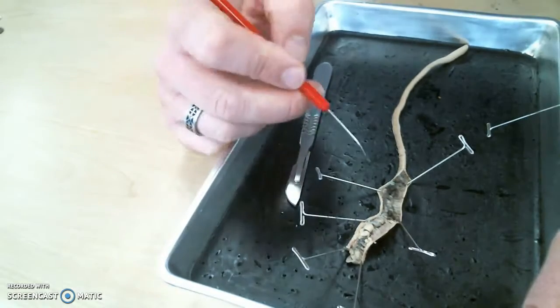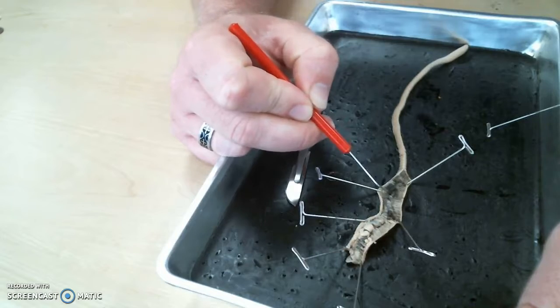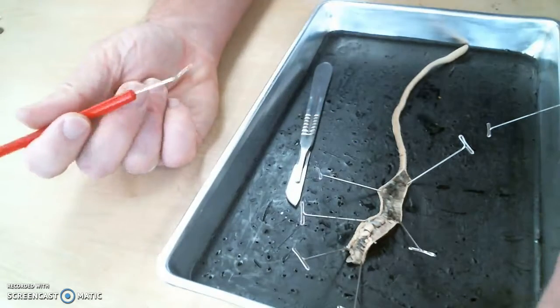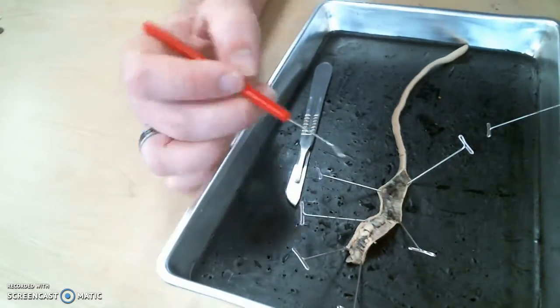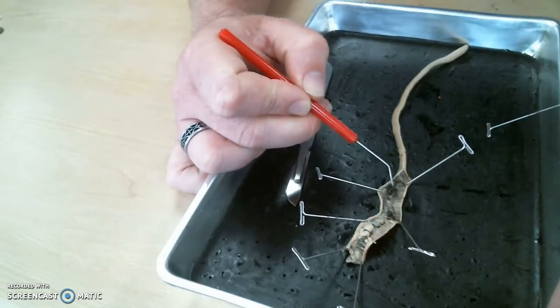The intestine. And when I started cutting a little bit too deep, I popped the intestine right here. And all of this black stuff is soil that the worm was in the process of digesting all the edible portions out of. So this is dirt that is in the process of being digested.